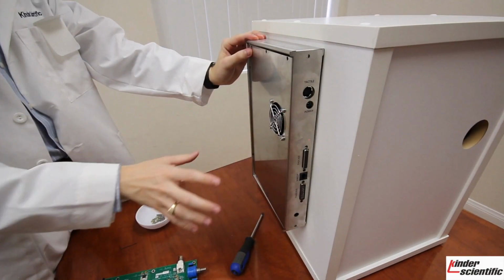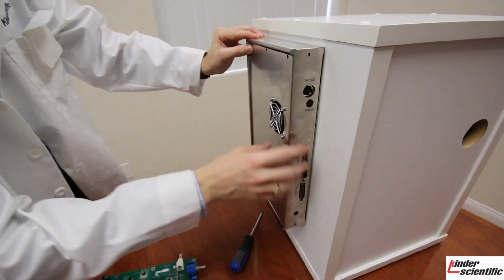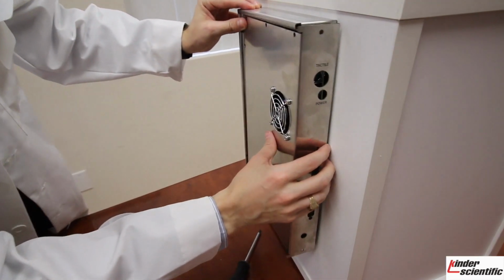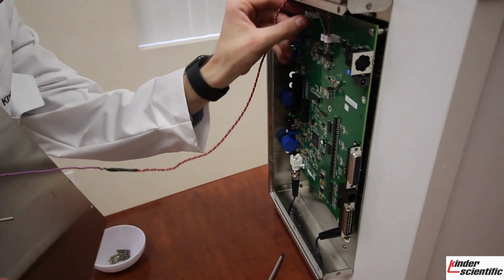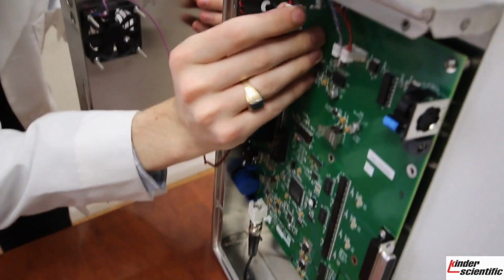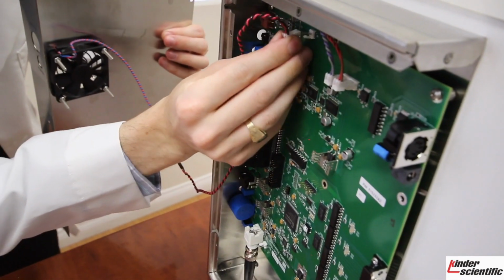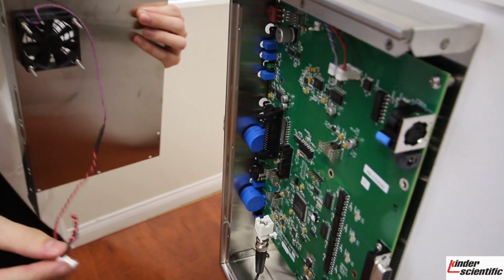So after you remove all the screws and the jack screws, you should have 10 screws removed and 4 jack screws. Make sure not to lose those. You will then pull back slightly and remove. You will see that the fan is attached to the board up here in the top left. Just go ahead and unplug it there. You can see it just plugs in right there. Set this off to the side.